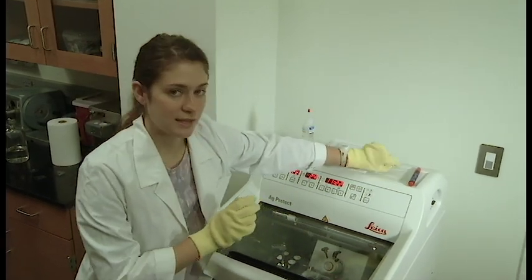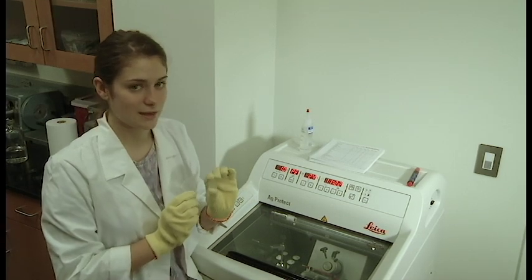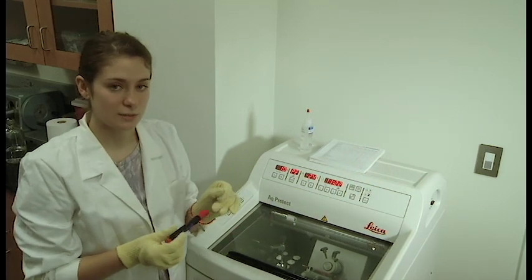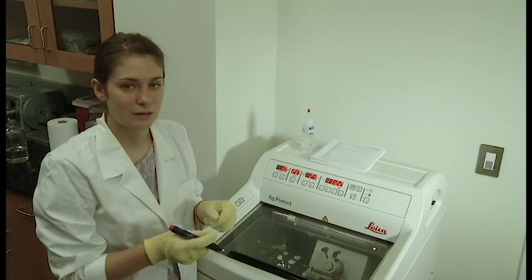But after you slice your tissues, you're going to pick them up on these microscope slides. And you're going to use them from room temperature, so the frozen sample is going to adhere very well.